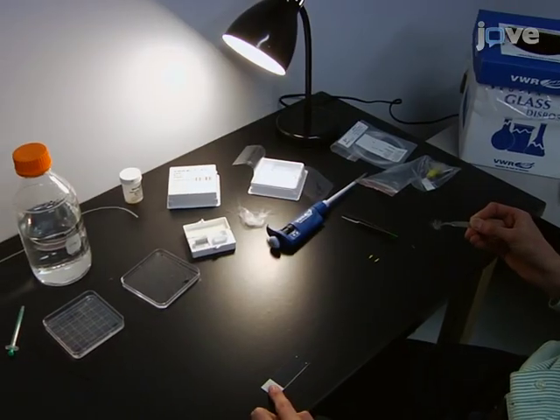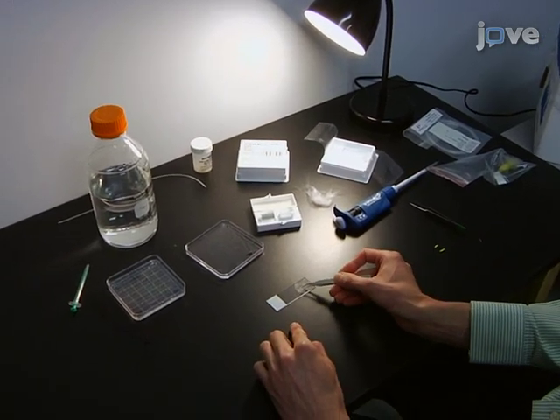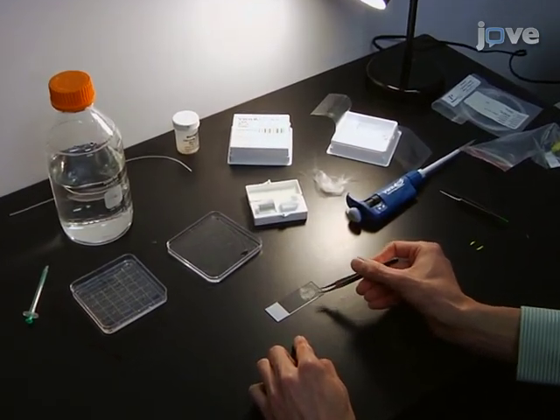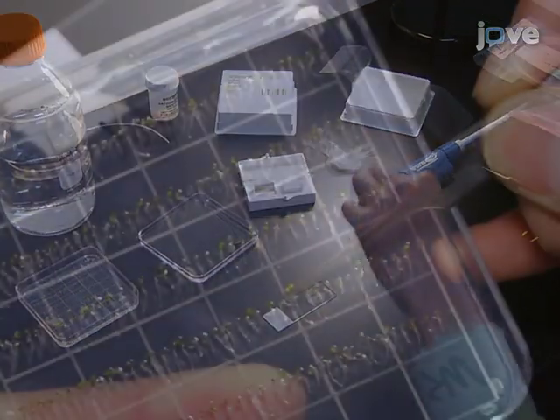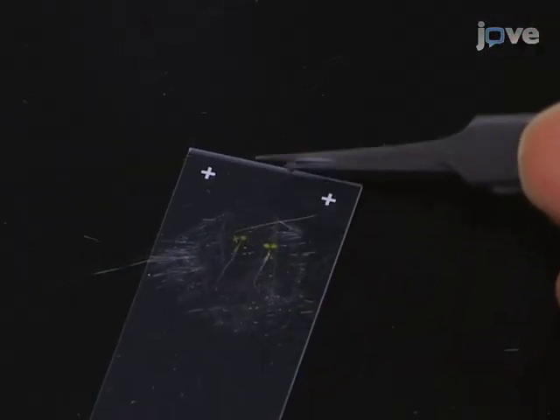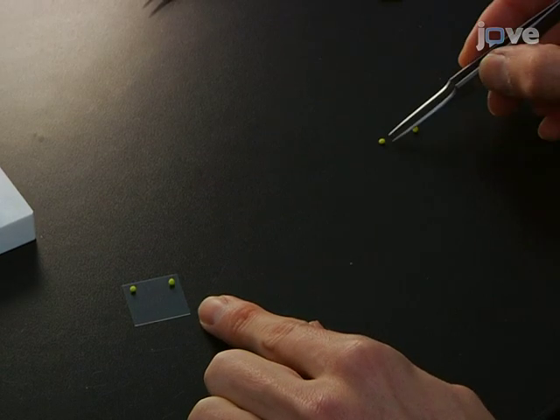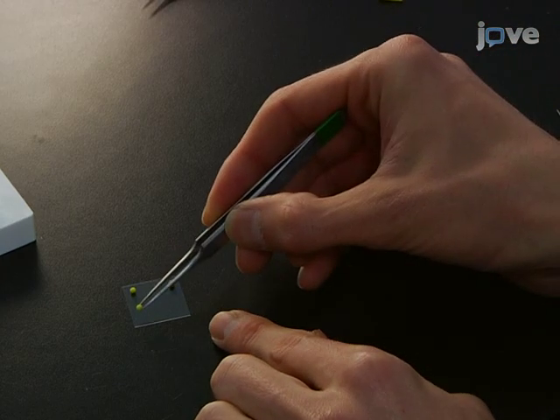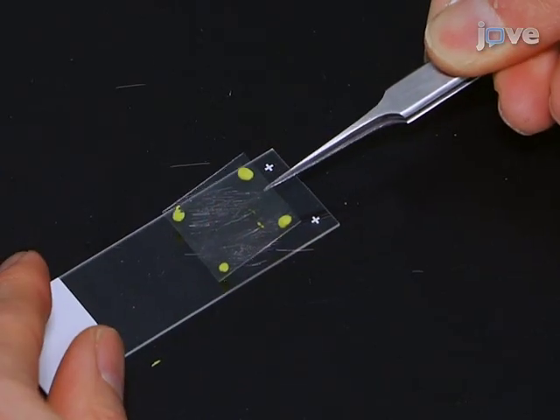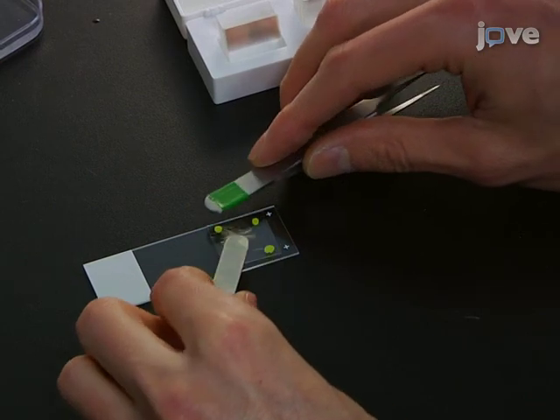In the meantime, assemble an imaging chamber with a slide and a cover slip. Place a piece of water-soaked cotton wool on the top of the slide. Then, transfer 1 or 2 5-day-old seedlings from the plate onto the middle of the slide. Then, stick small pieces of clay to each corner of the cover slip and place the cover slip on top of the seedlings to create a gap between the cover slip and slide.